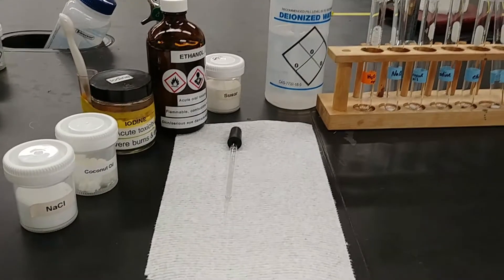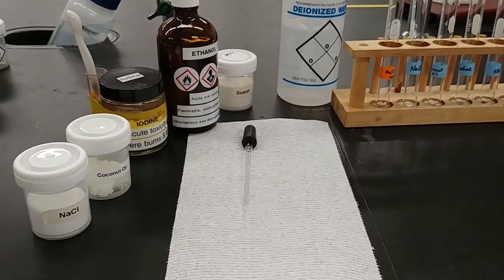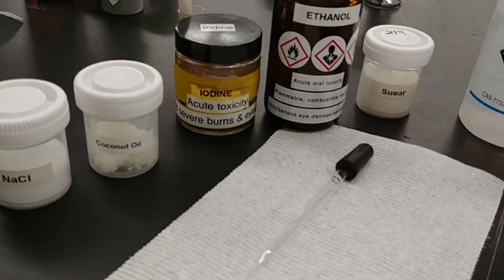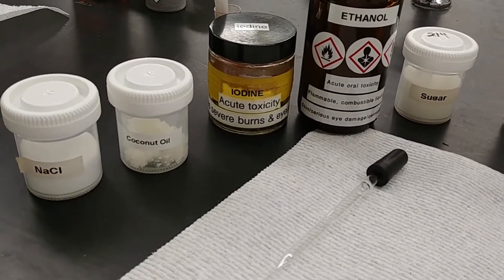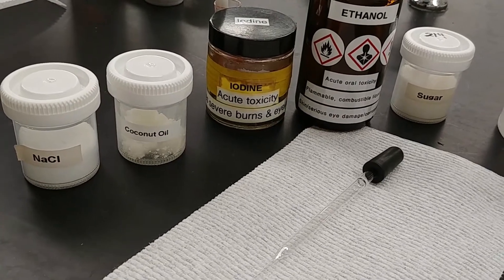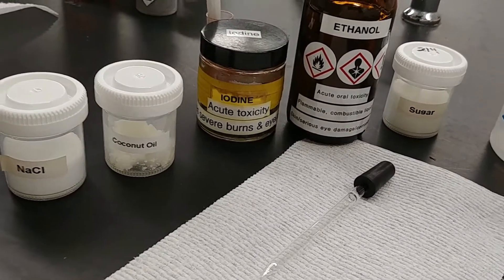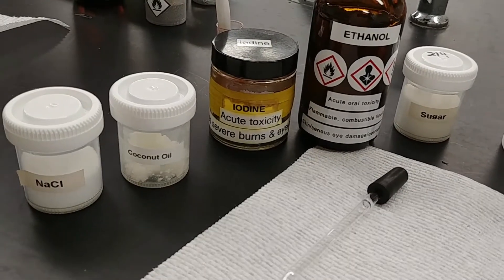For this experiment we are looking at the solubility of a couple of different substances in different solvents. We're going to look at the solubility as an expression of whether something is polar or nonpolar.